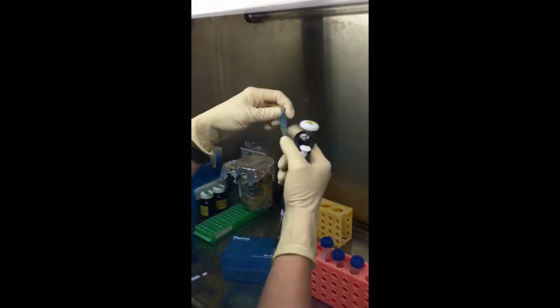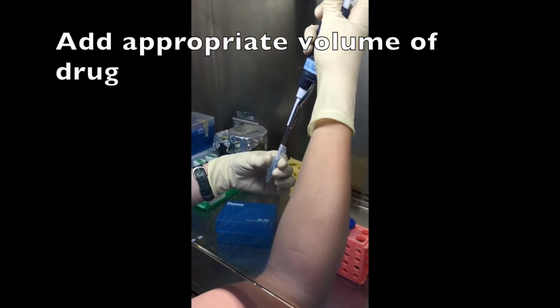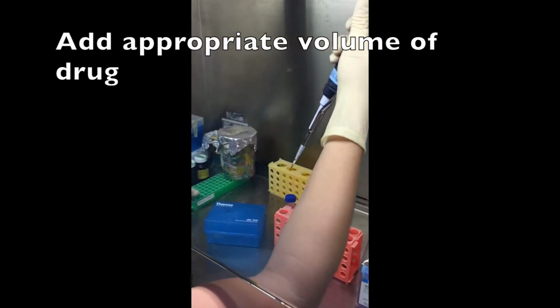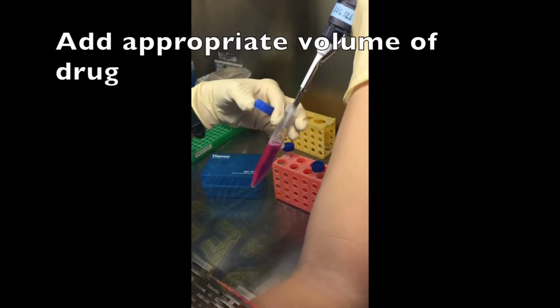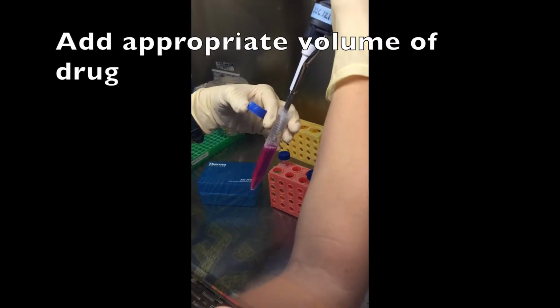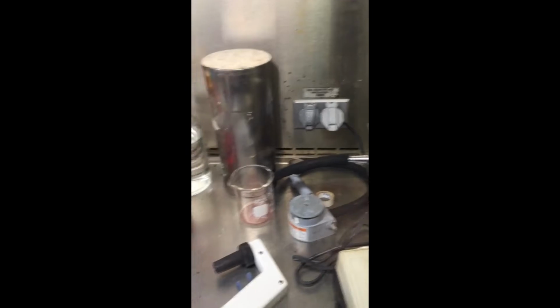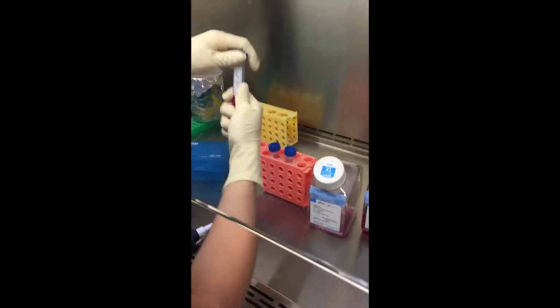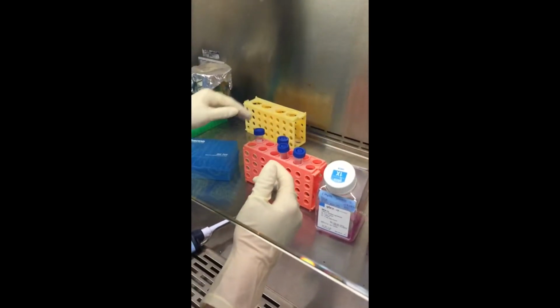So then I will make sure my drug's all mixed up. Take out my 16 microliters. And when you put it into the tube, make sure you're in the media and go up and down a couple times to make sure all the drug has come loose. So that one's complete, and I like to move them back once they're complete and tighten the lid so I don't get them confused. The next one was 32 microliters.